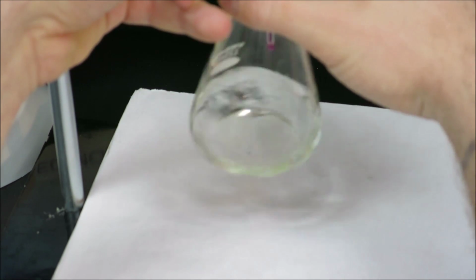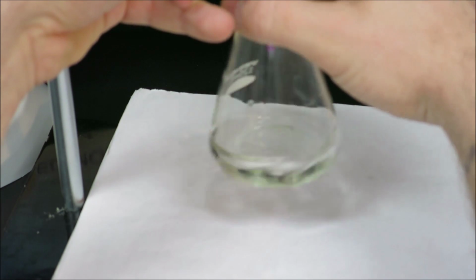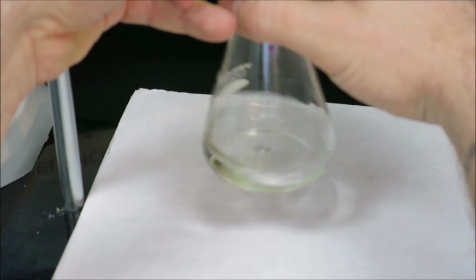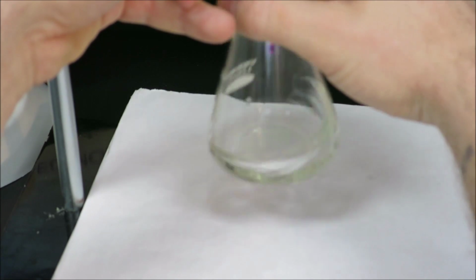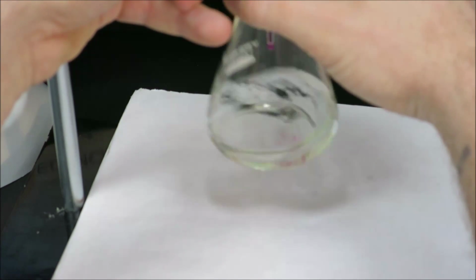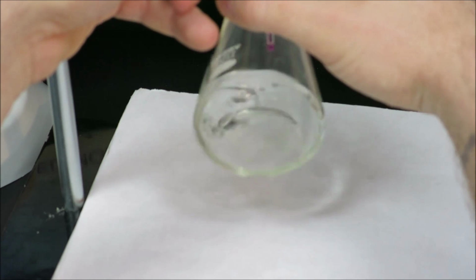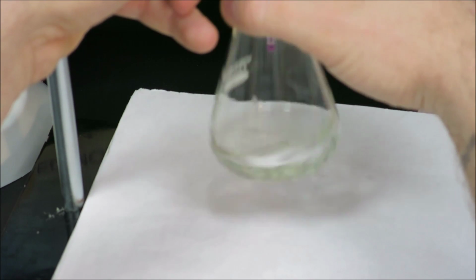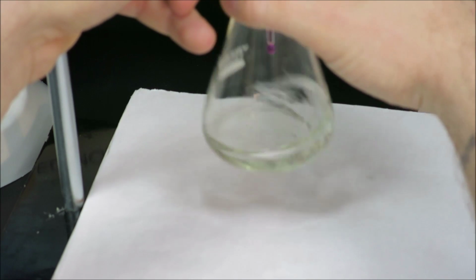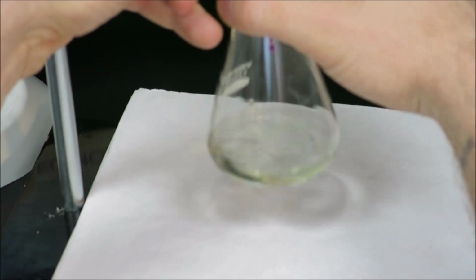And we'll continue to swirl. It's very important to continue to swirl because the swirling keeps all of the moles of the reactants mixing. So now I've slowed down my drip pattern. And we'll continue at this rate for a while until I notice that the color takes even longer to fade, in which case I'll slow it down even more.